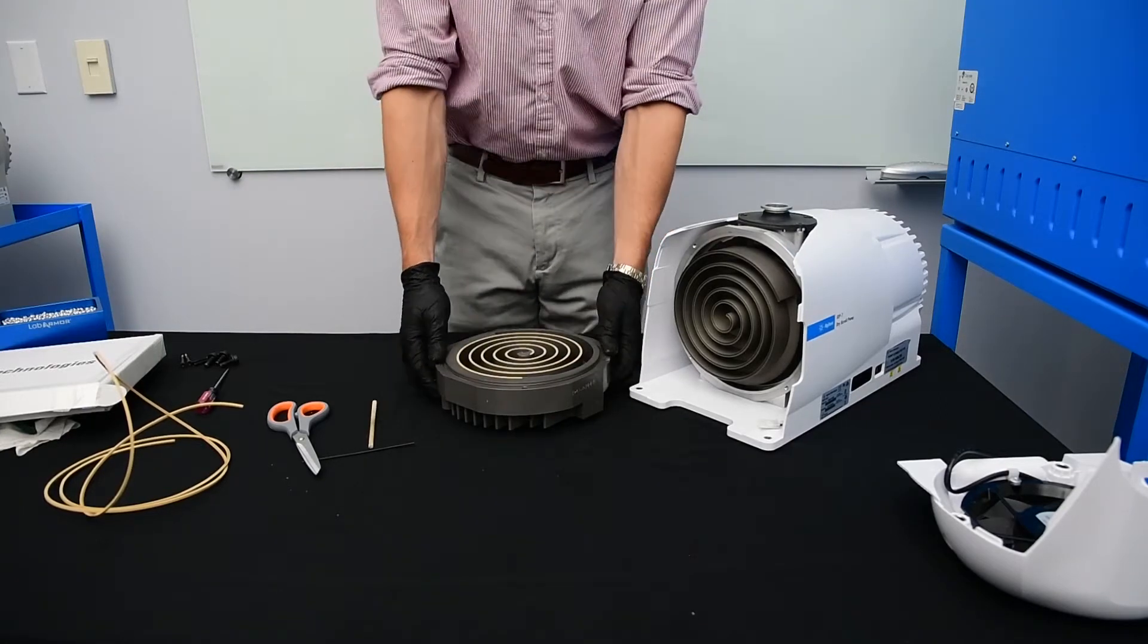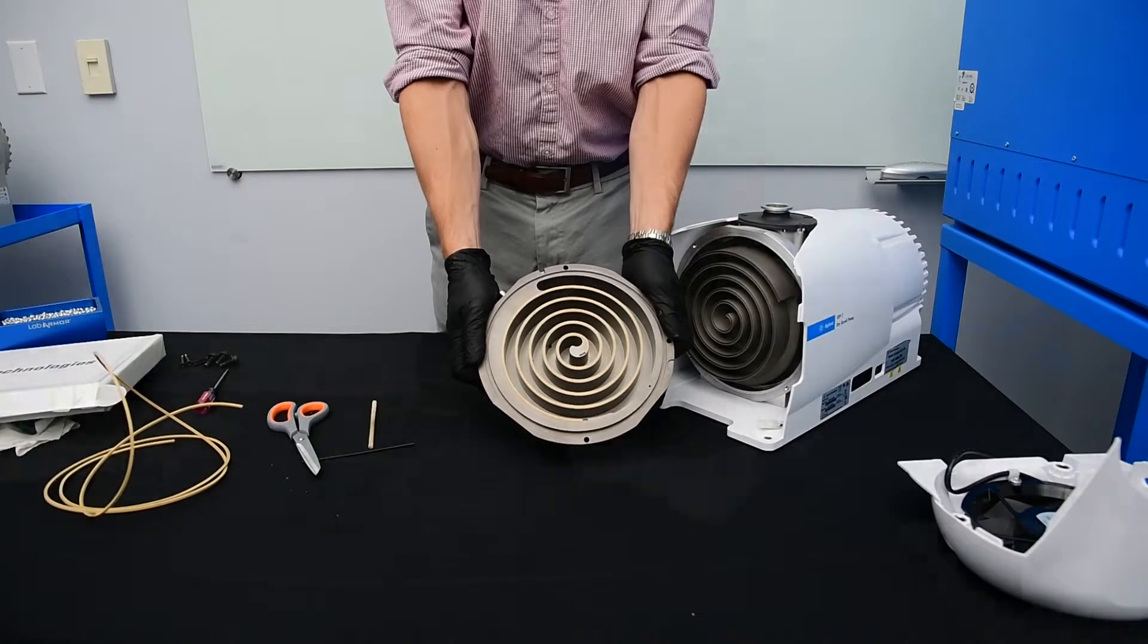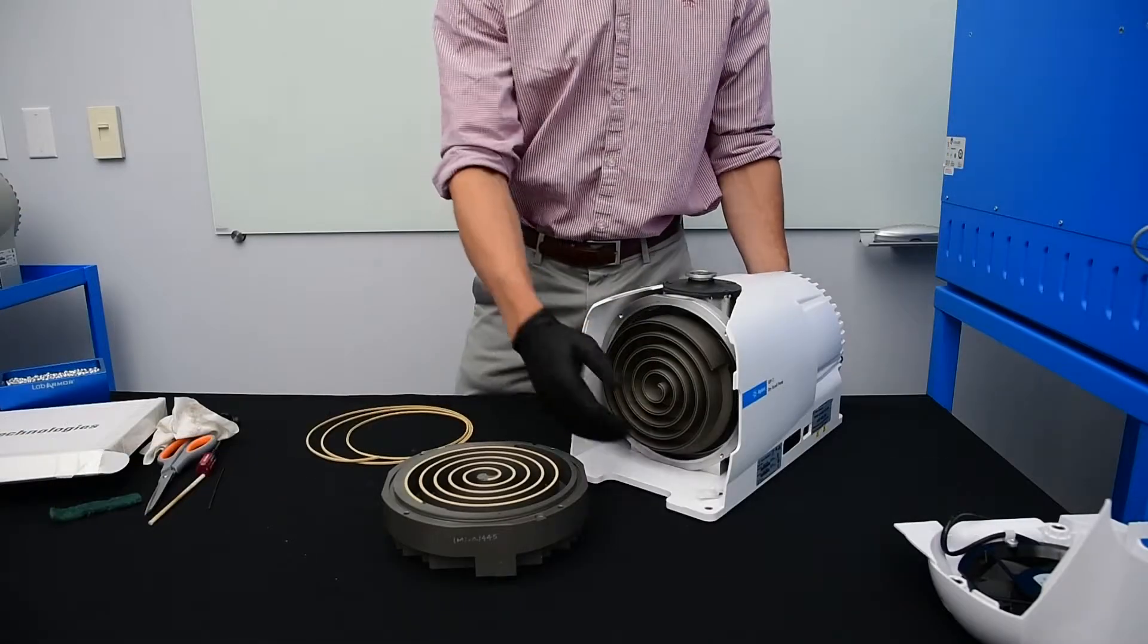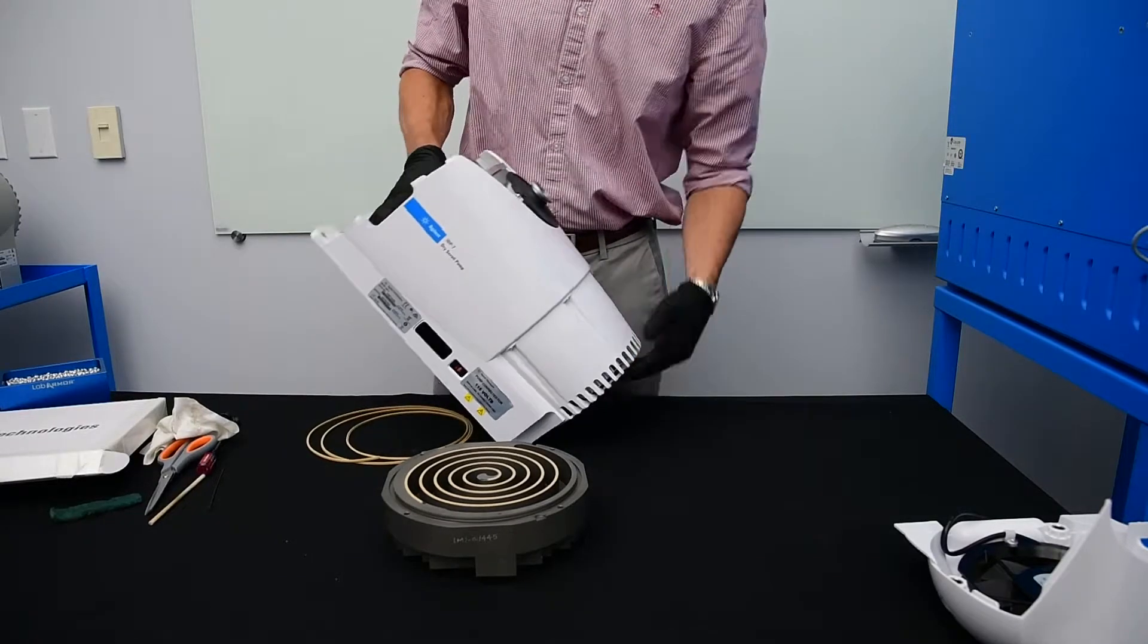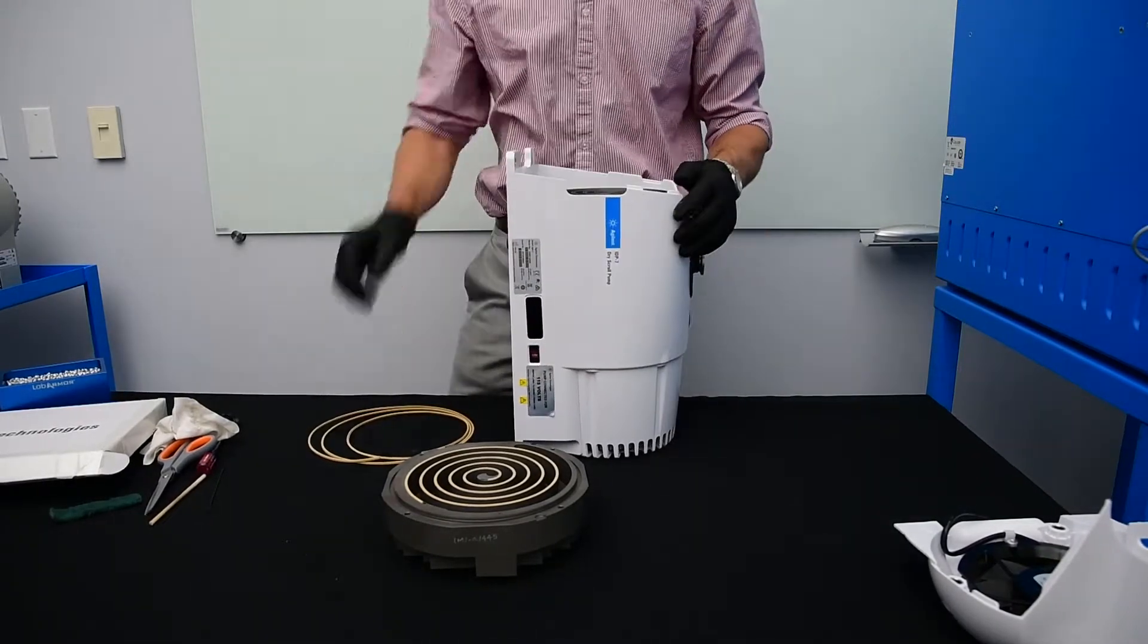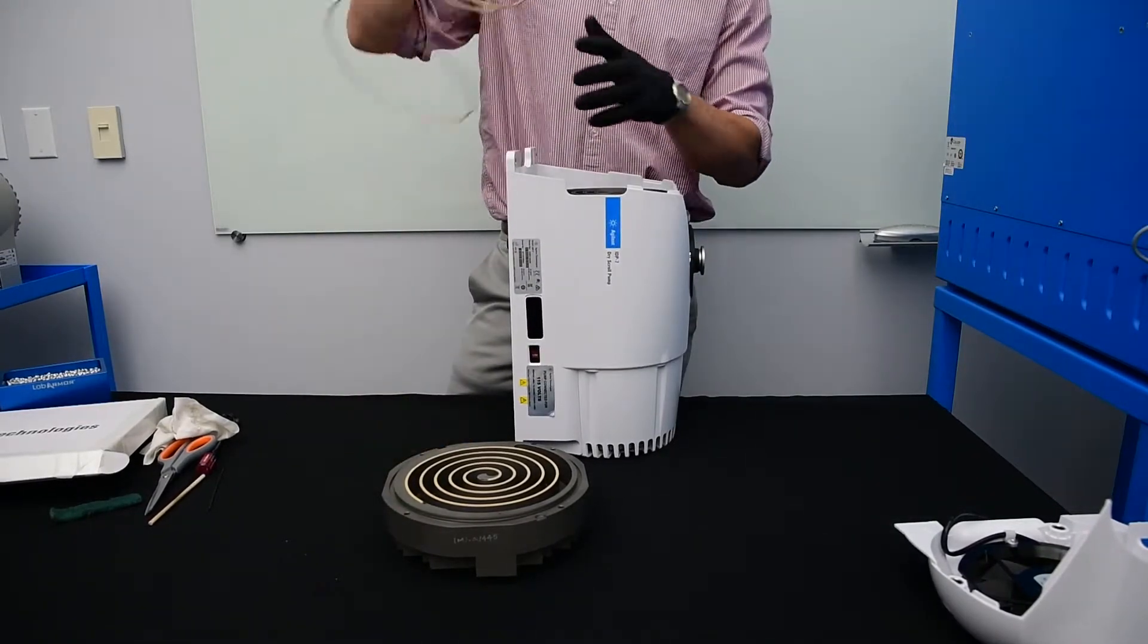Next we'll repeat the process on the orbiting plate. Next we'll turn the pump up on its end and install the tip seal in this portion.